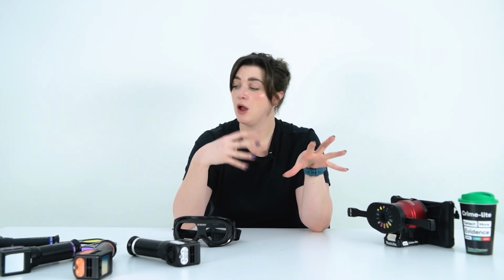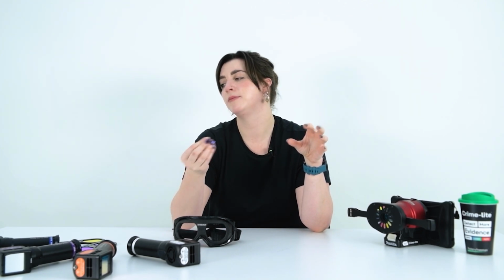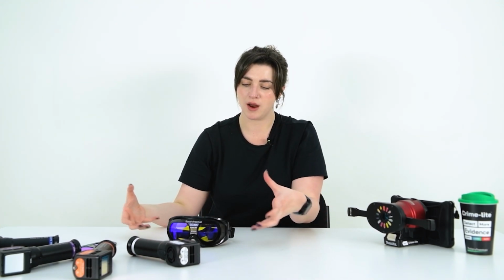So we can either simply look at that colour or look at the goggle prompt that is on the light source, in order to show us which goggle or filter we should be pairing with each light source. The filters that we supply with the Crime Light Pro Vision goggles are magnetic onto the front. So these filters are interchangeable. We have one base goggle and the magnetic filters can be interchanged onto the front of the goggle depending on which light source is being used.